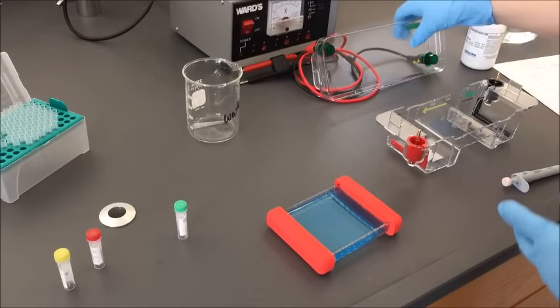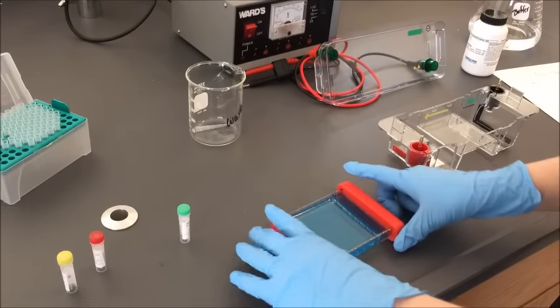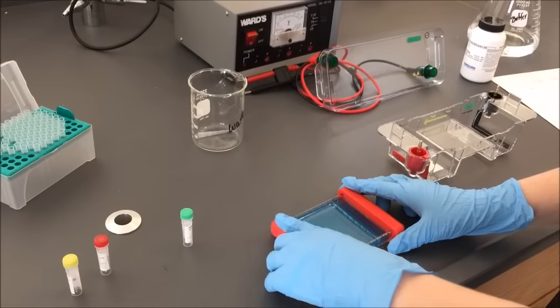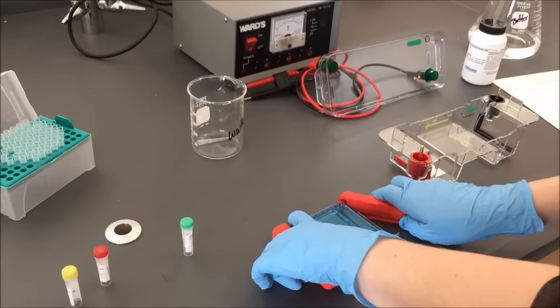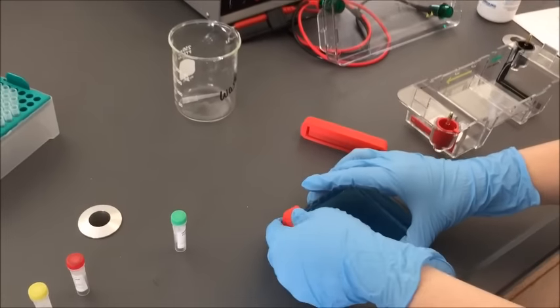This is the bottom part, and this is the top that goes with it. To prepare it to go in, I need to remove the bumpers — these are those red plastic parts on the side. These were used to allow the gel to set, but now that we're actually going to run it, we need to take them off. They are just squeezed on the edges, so very gently but firmly, I pull them directly off on each side.